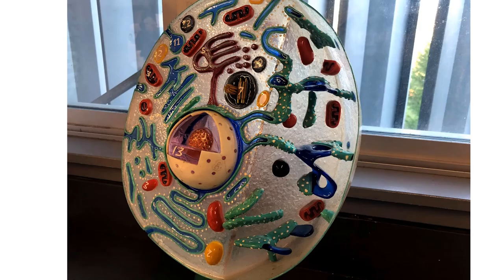This is going to be the laboratory associated with the anatomy of cells and also cell division, so mitosis. So I want to begin with just looking at a model of a cell. And so this is one of the models we have in the lab. So if we look at the different parts that we've discussed so far in the lecture, we have a cell membrane, we have a nucleus, one nucleus in this case, and then we have all the organelles.